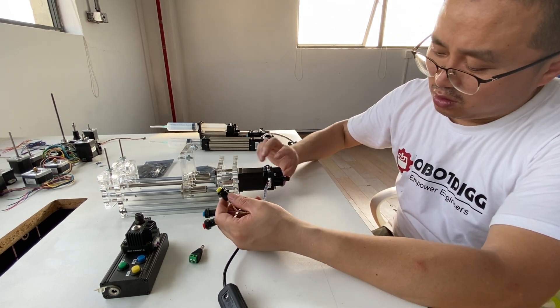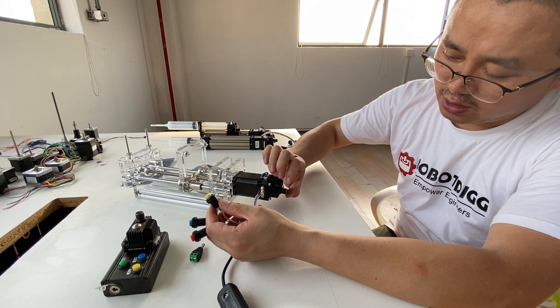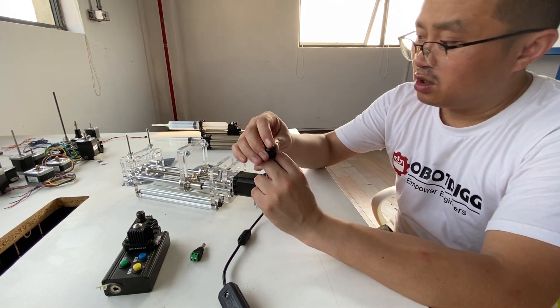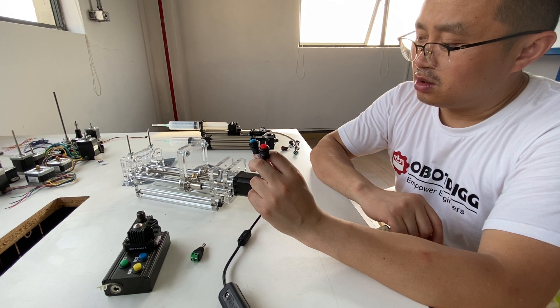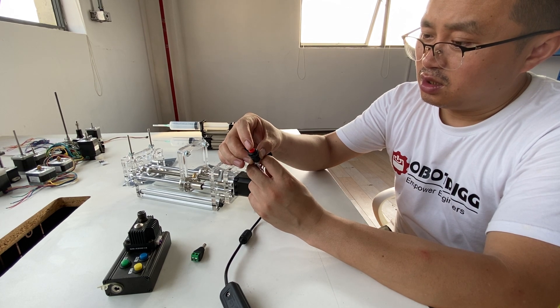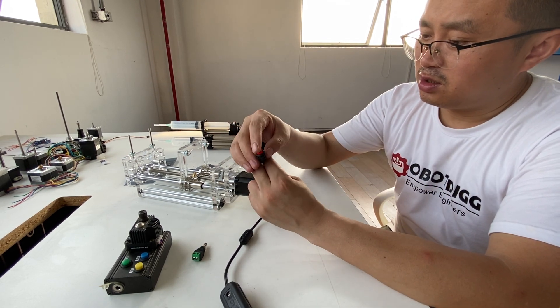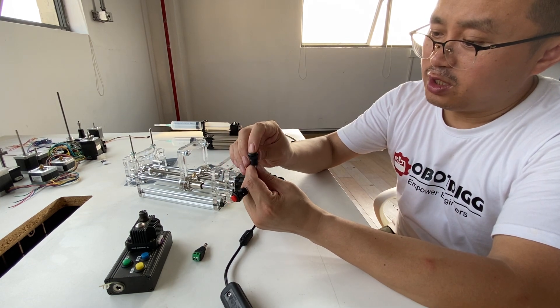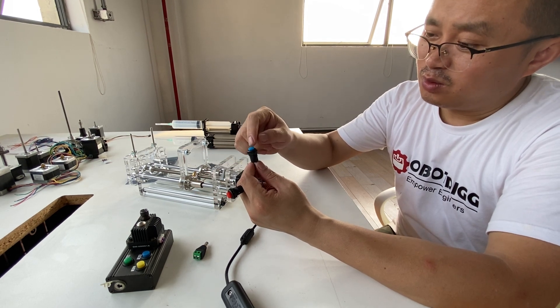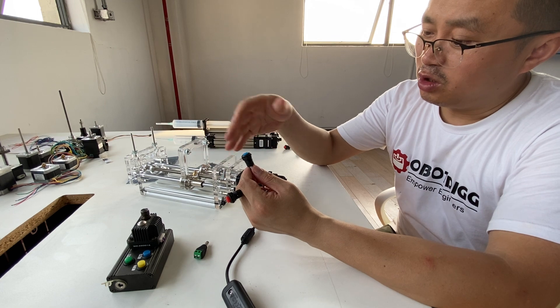Let's check it out. Now we just give it a speed using the potentiometer on the side — turn to some speed. Now we just click this button. If we click the blue button and click the red button again, you see that the speed is different. If we just release the blue button, the speed is slow. So the blue button works just for speed change — for higher speed or lower speed.